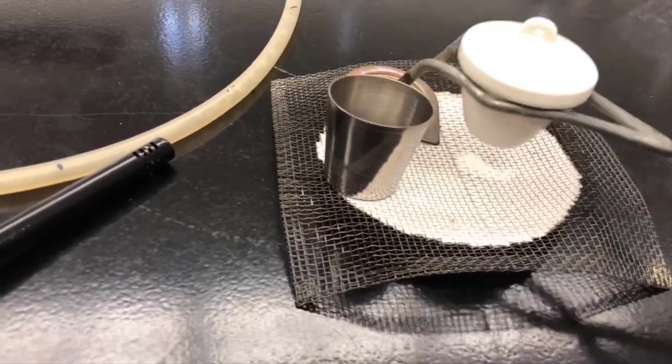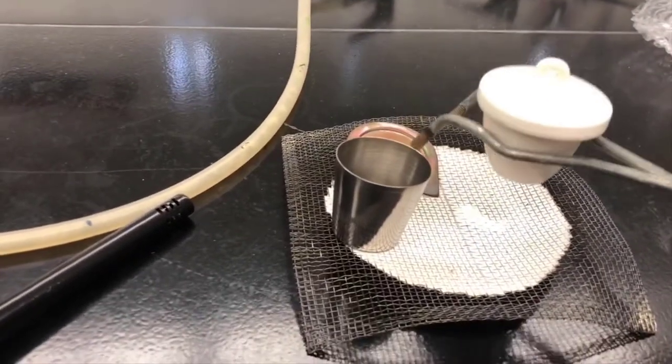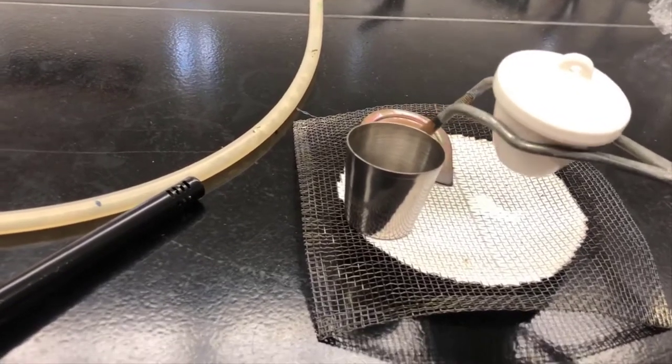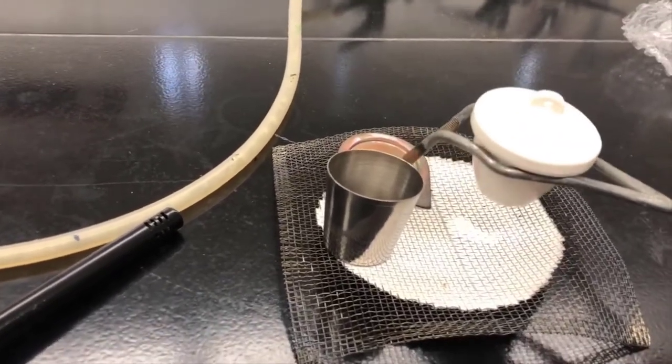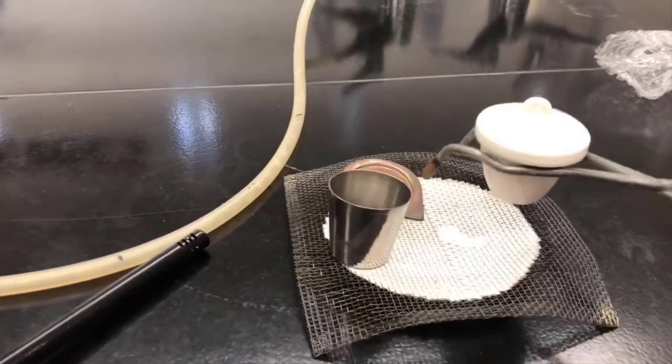But if you're careful with a little practice, don't panic if it starts sliding up like that. Just keep your hands steady and you should be able to carry it just fine.